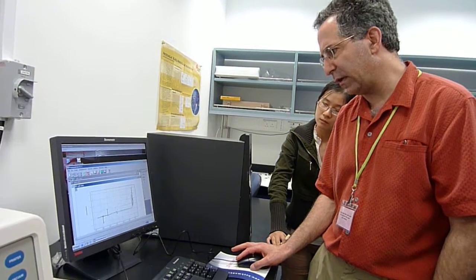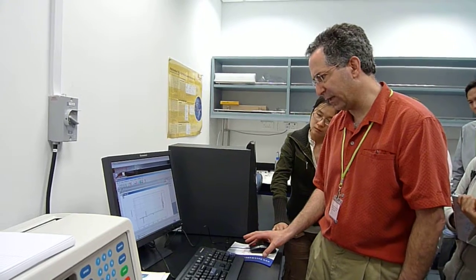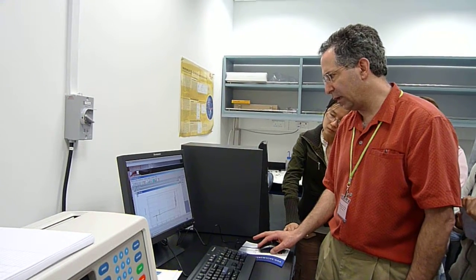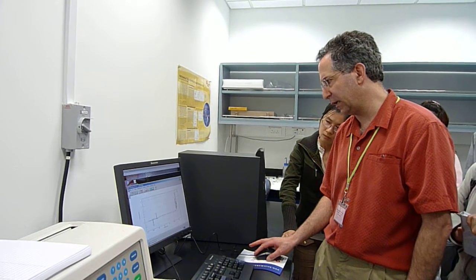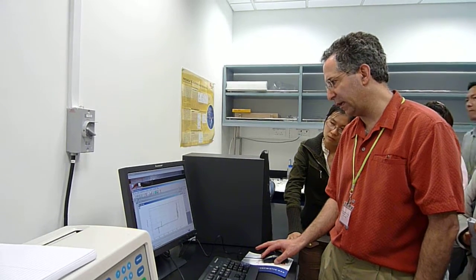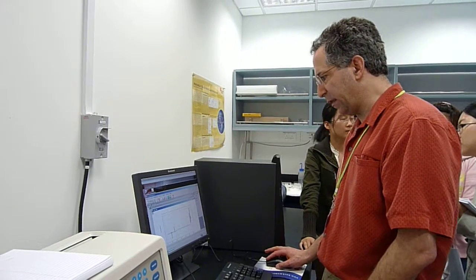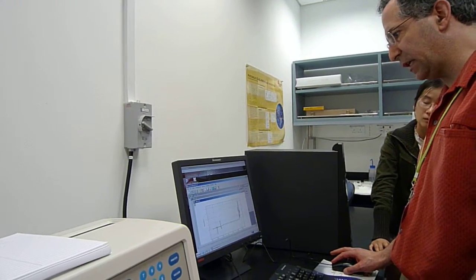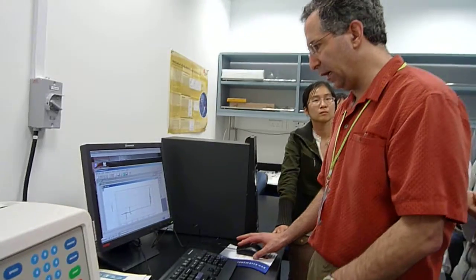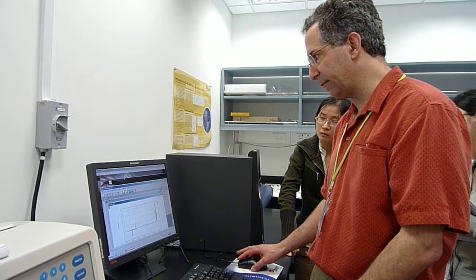The absorbance on this one is around 0.2, which is about what we would have thought. Again, I'm just ballparking it. There's a 10-fold range that we set up between these cells. So it's the middle cell that looks like it had a little channel leak. But we can try to analyze it, and even if it's a problem, we can still live with it. The thing I'm a little concerned about is that this one moved a little bit to the right. I hope that this one isn't leaking as well. It could be. We'll only find that out as we run additional sequential scans.